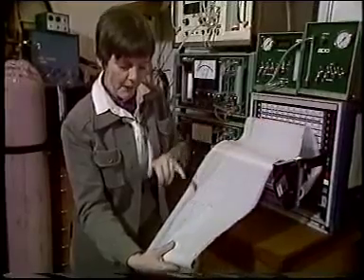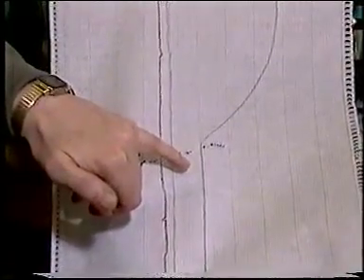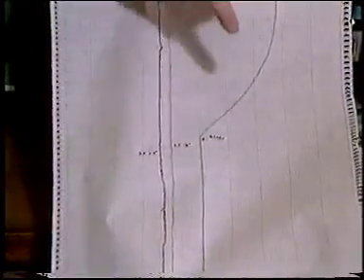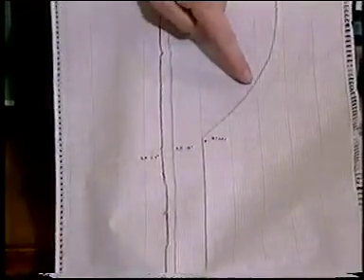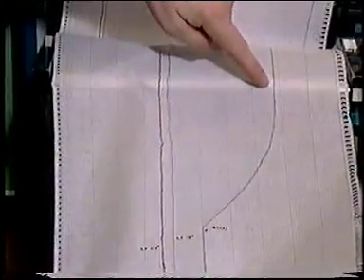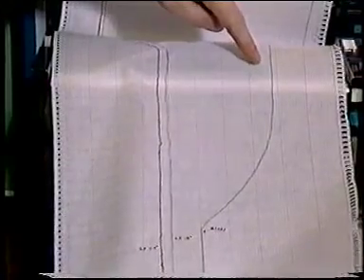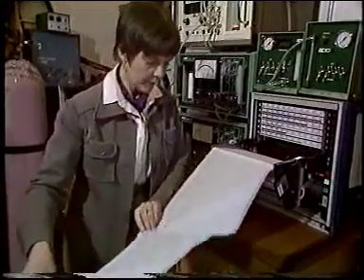Here's the start. Now, at the beginning, this straight line, there was no CO2 difference between input and output from the chamber. When the lights were turned on, when the experiment was started, then gradually CO2 uptake began. And this is net CO2 uptake because, of course, the leaf is carrying on respiring whilst it's in the chamber.